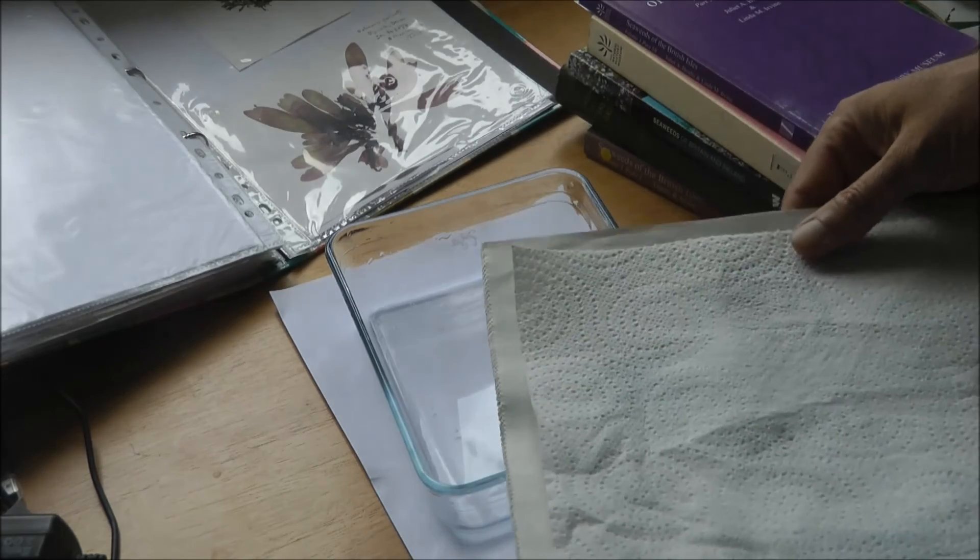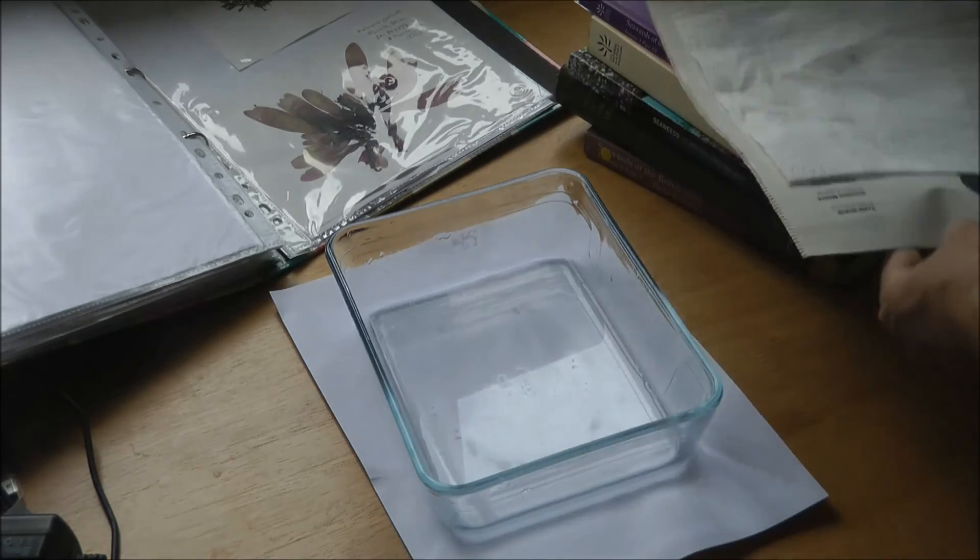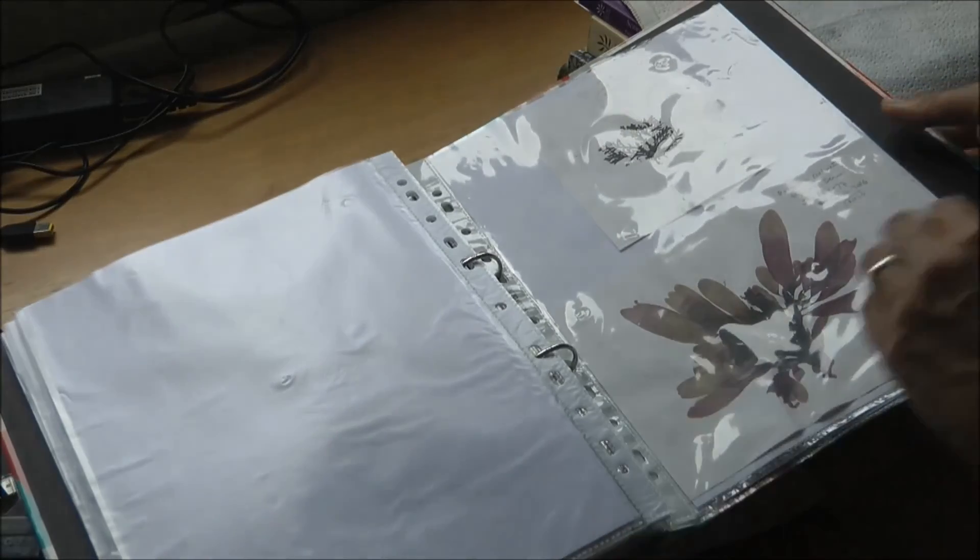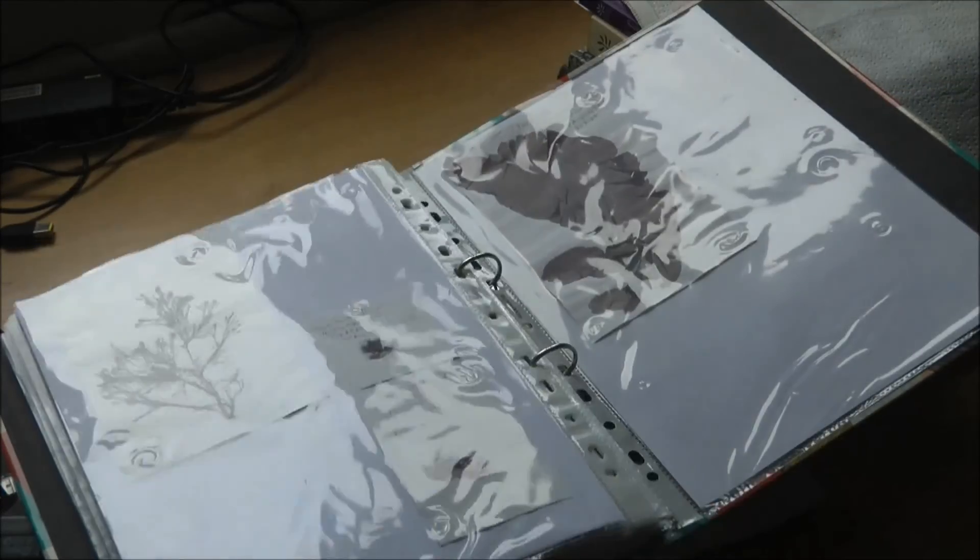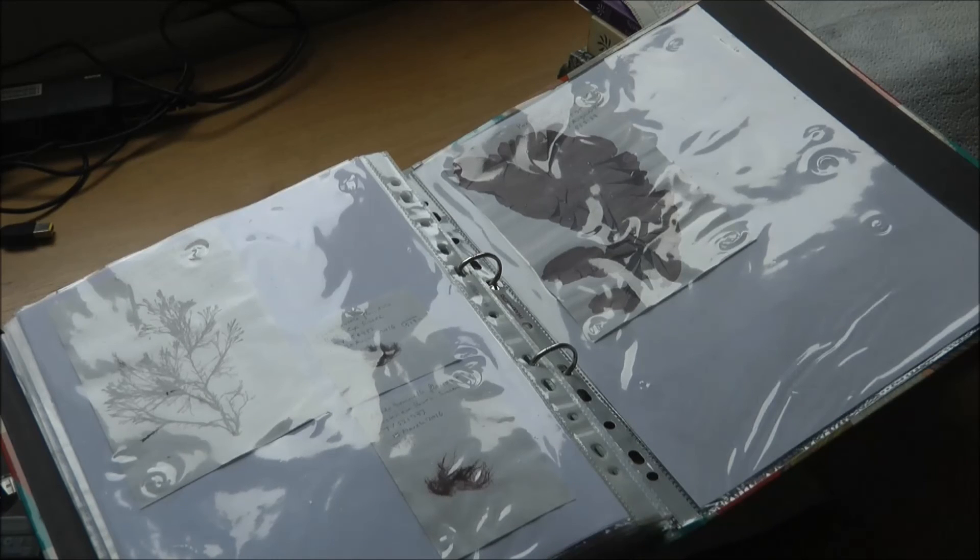Nice and simple. Here we go, and we can have a little look at some previously prepared examples. Great.